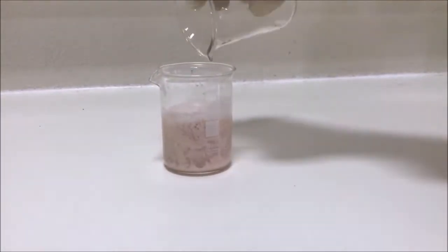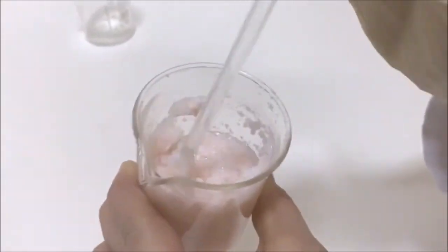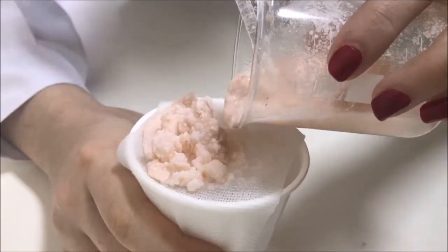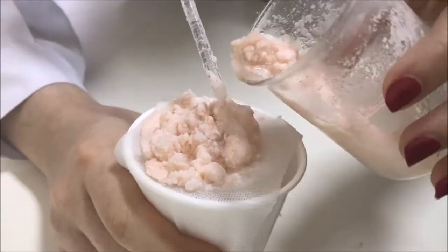Add the sodium chloride solution to the soap mixture. Coat a plastic cup with cheesecloth and pour the liquid into it. Here we are decanting the liquid.